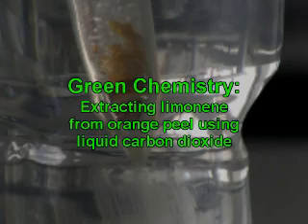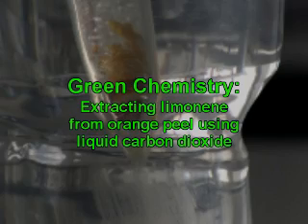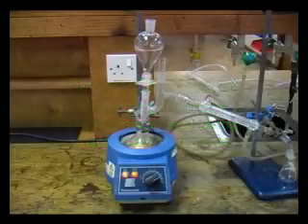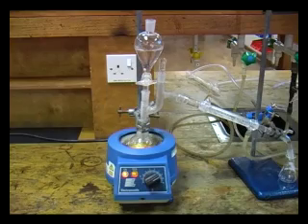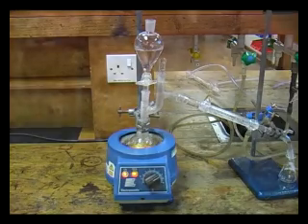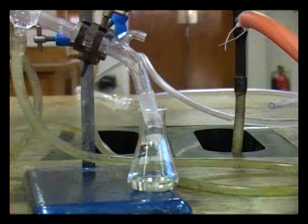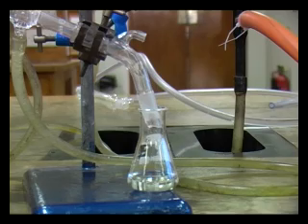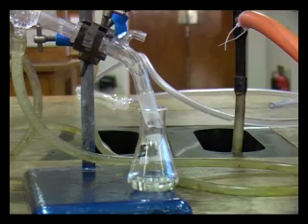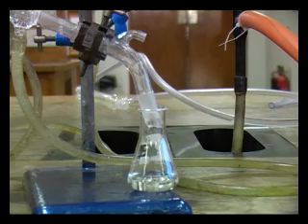A traditional method for extracting natural products would be to use chlorinated hydrocarbons, which we prefer not to use nowadays. An alternative method is steam distillation, which you can see on the screen. This is an energy intensive method and not particularly efficient, and it goes against the principles of green chemistry.